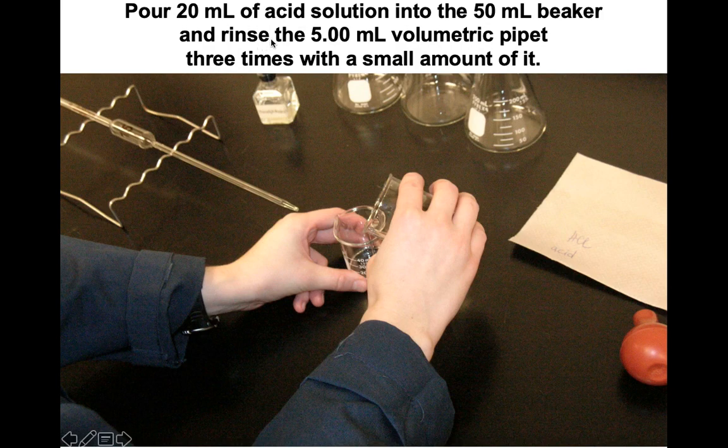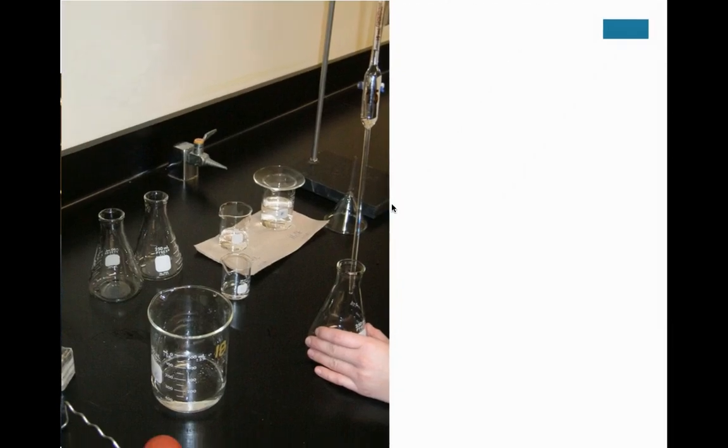Now think about what happens if water is in there. Then what would happen to the acid if we put it into a wet beaker? So now we're going to rinse a 5 milliliter volumetric pipette 3 times with it, and the volumetric pipette is over here. And so let's take a look.